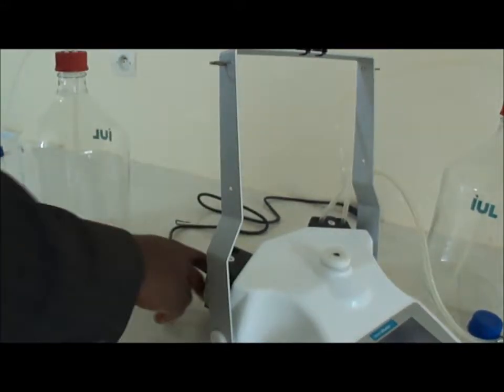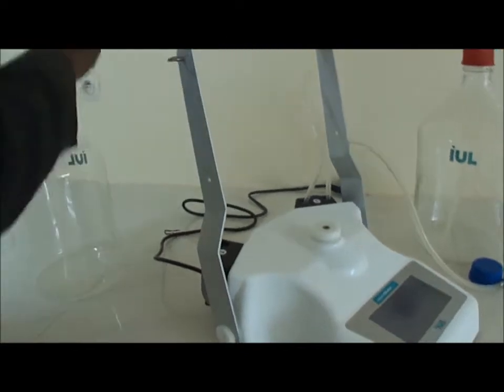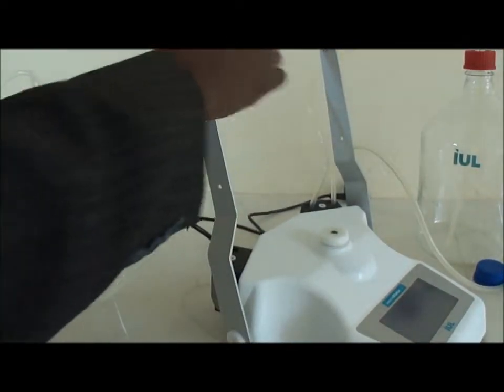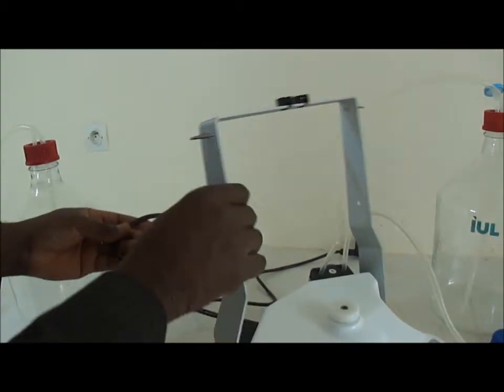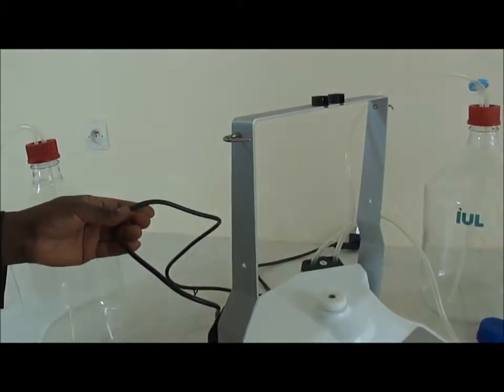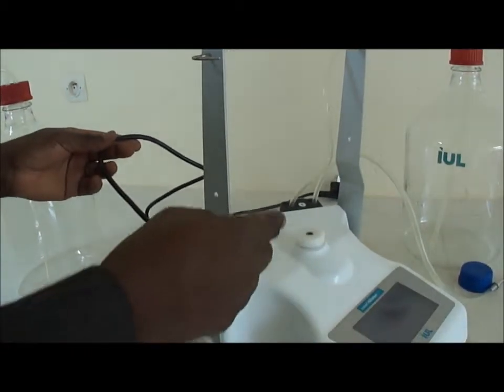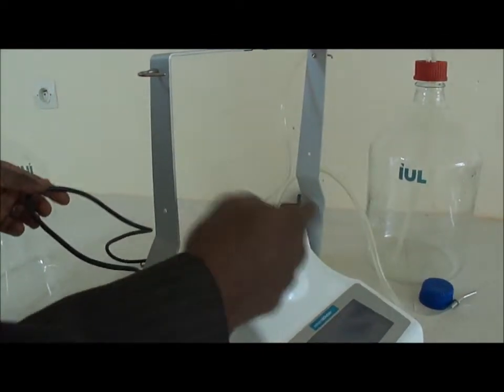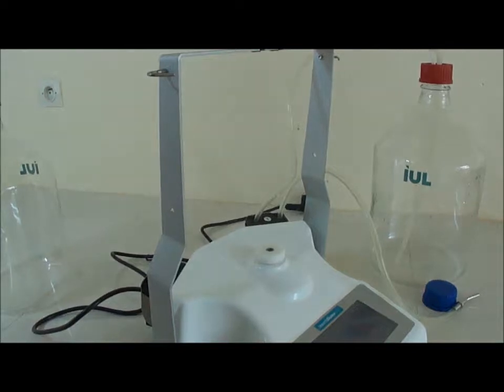If it's in the back and the device is connected to the electrical socket, there is no pumping. But if it's in the front, it will start to trigger the pumping from the bottle of the diluent and mix it with the sample.